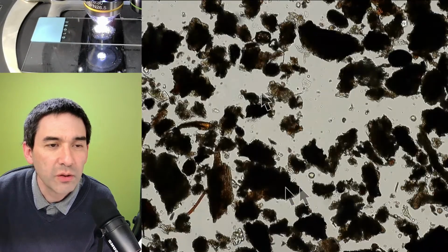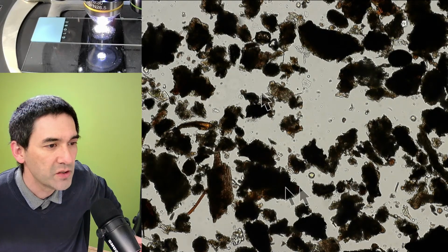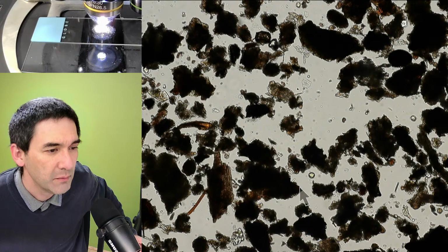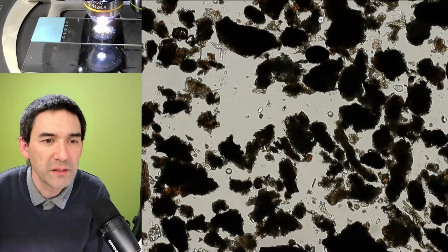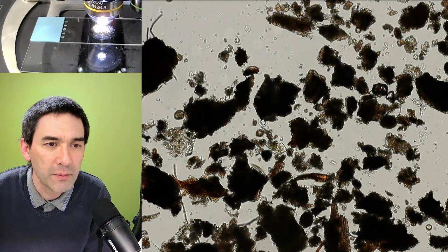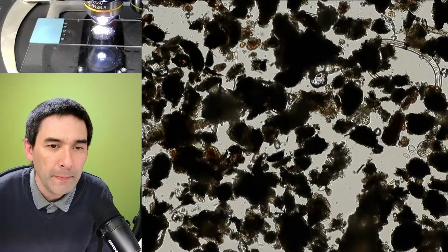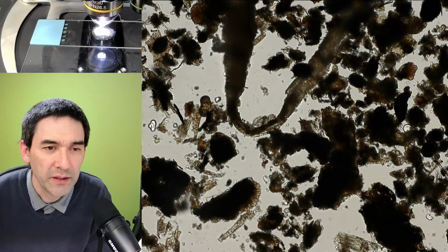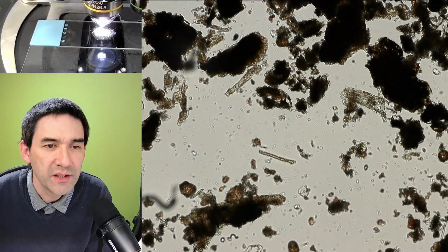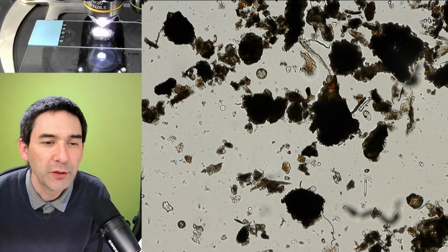Always, so in case you're wondering what I'm doing, I like to simply do a little bit of exploring this way. Let me quickly switch off the arrows again, because they're kind of disturbing. So that's usually what I do. I collect some samples and then I simply have a look at them, hoping to find something more or less interesting. Yeah? Again, the next interesting thing would be how are you able to separate all of the moss particles, all of these things that you see here, from the rest. Yeah? And I've also seen some diatoms even in the sample. So there's quite a few things here.